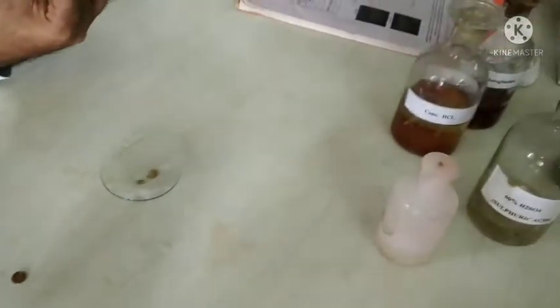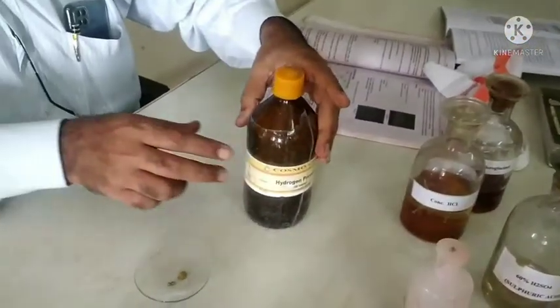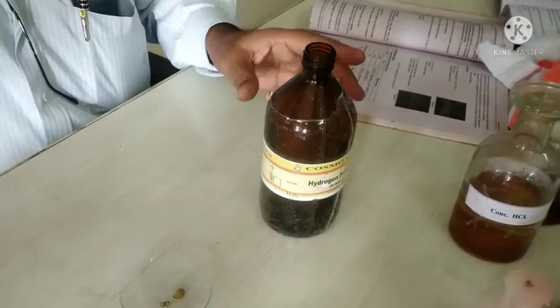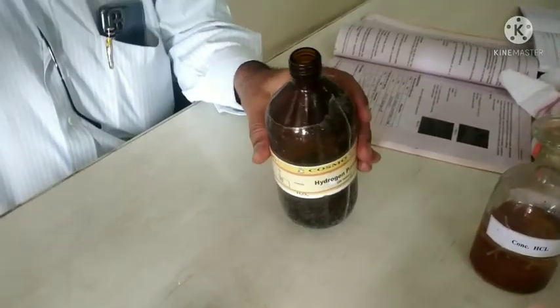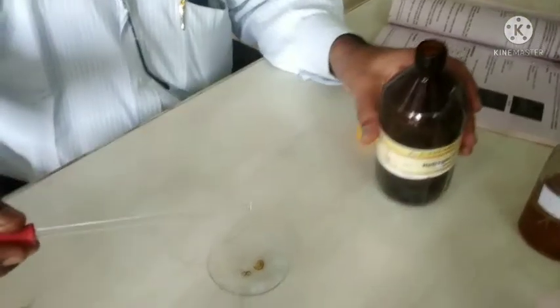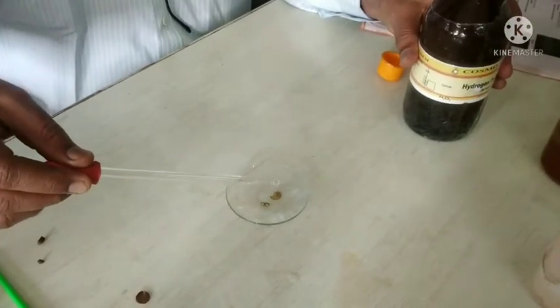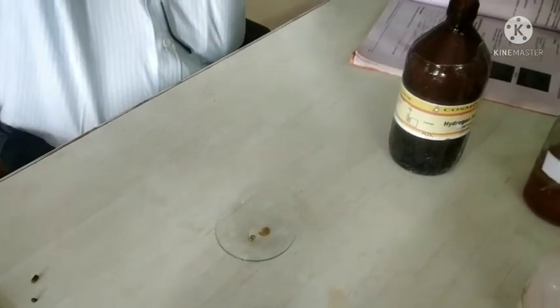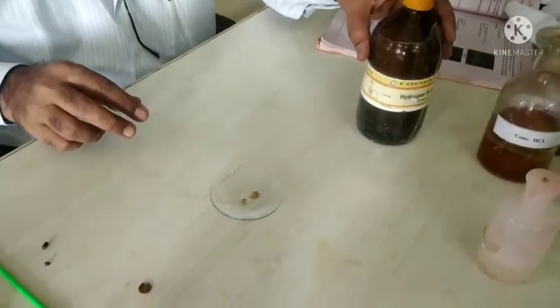Then bleach the section with the help of a bleaching reagent, that is hydrogen peroxide. Use 4 to 5 drops of hydrogen peroxide for bleaching, and bleach for at least 5 minutes. When we bleach the section, it reduces pigmentation, causes discoloration of the section, and makes the tissue clear in appearance. Bleach it for at least 5 minutes.